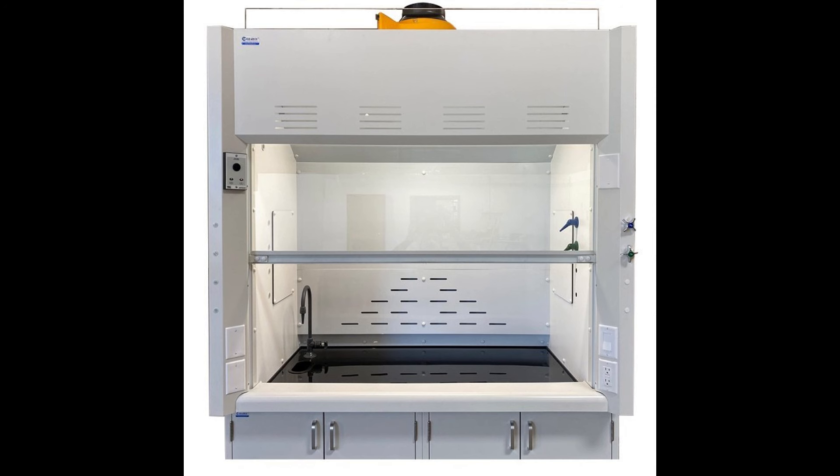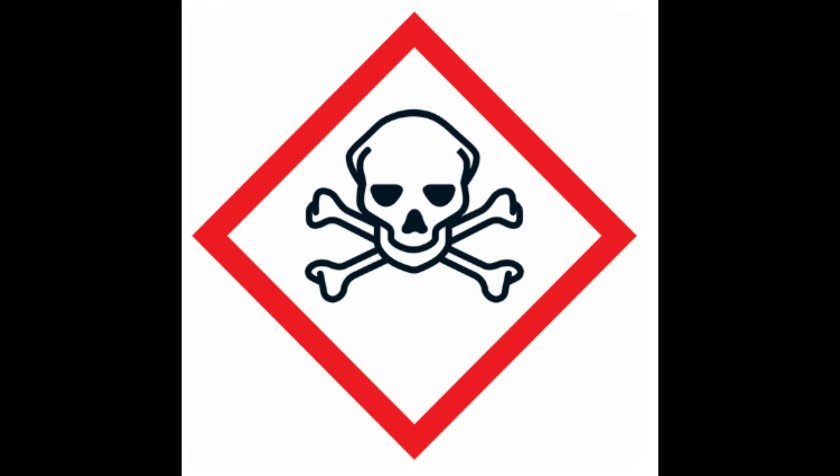This operation will be carried out in a fume hood with good ventilation or outdoors. Hydrogen cyanide gas is produced, which is very poisonous.